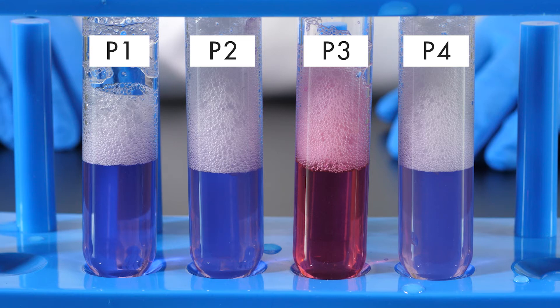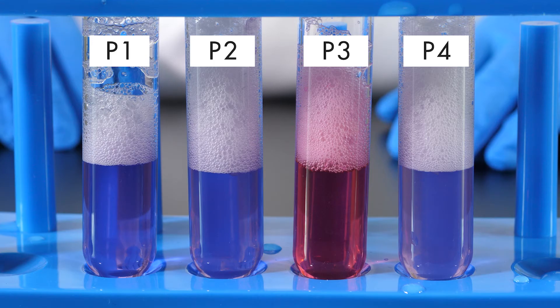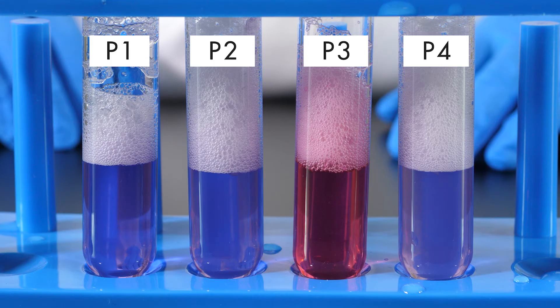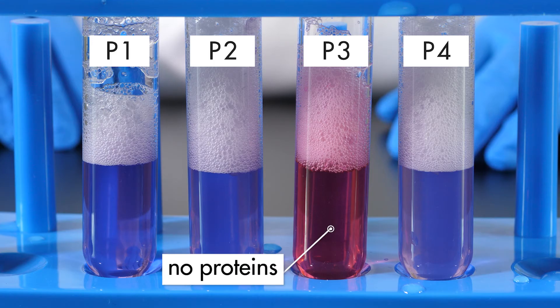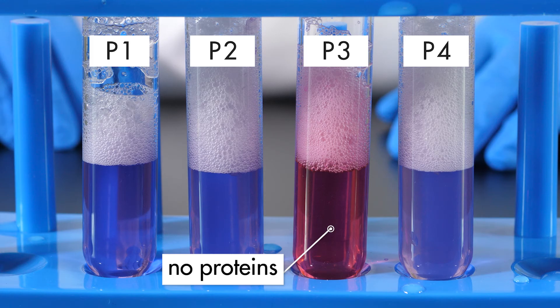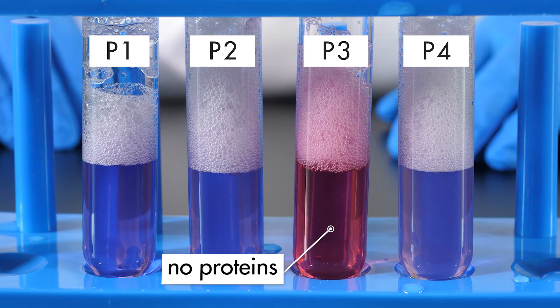Test tube P3 contains albumin and the pepsin hydrochloric acid mixture. Notice that the solution in this test tube turned pink. The pink color indicates that the proteins have been broken down into amino acids. This confirms that pepsin and hydrochloric acid are both necessary for the digestion of proteins.